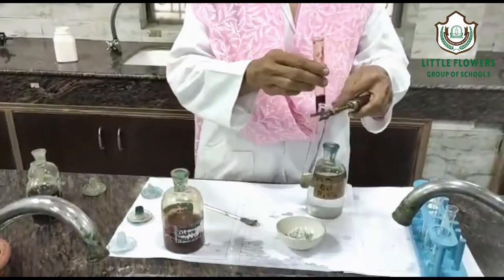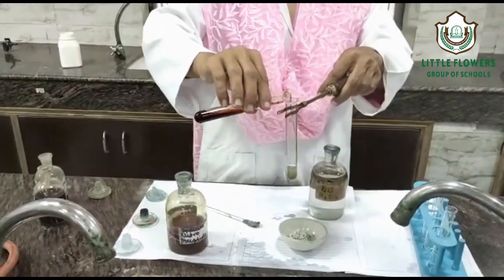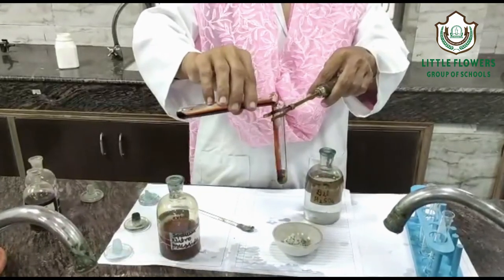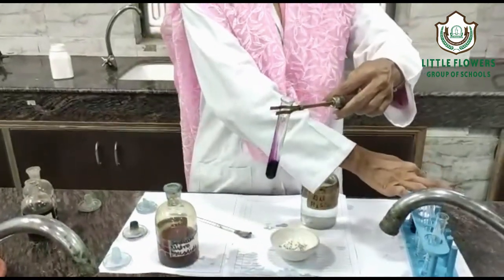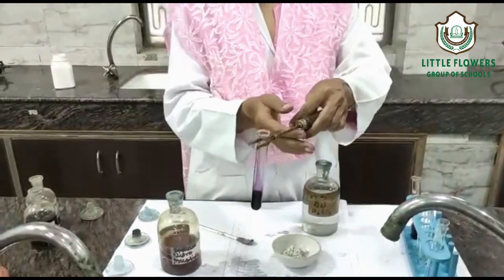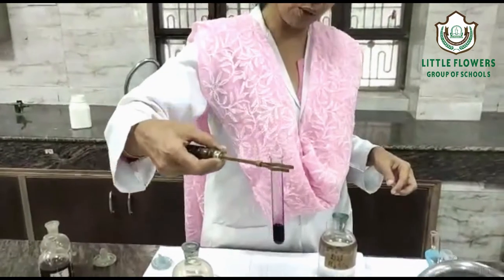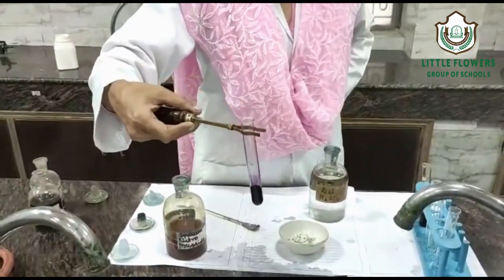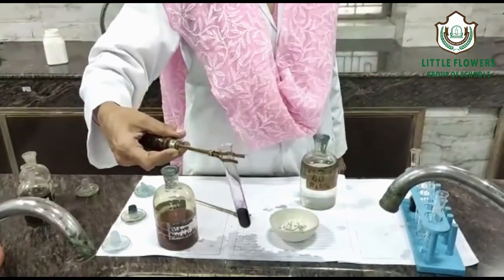Here we have taken the solution — you can see. Purple colouration is observed. If purple colouration is present, it confirms that in the given salt, the S²⁻ radical is present.